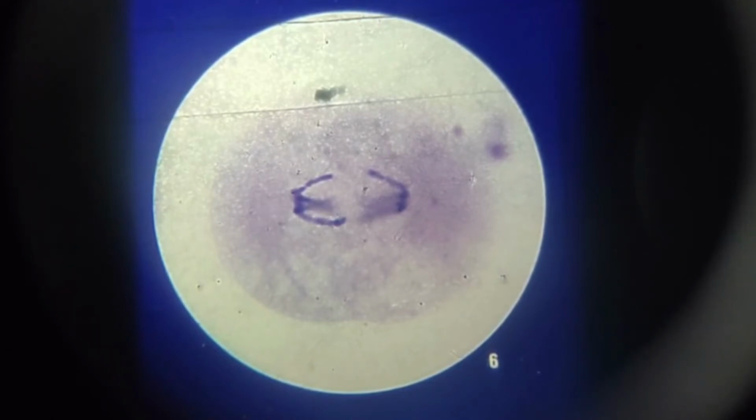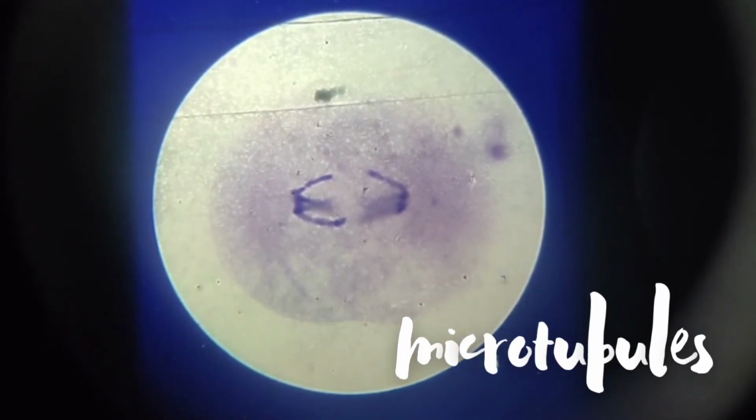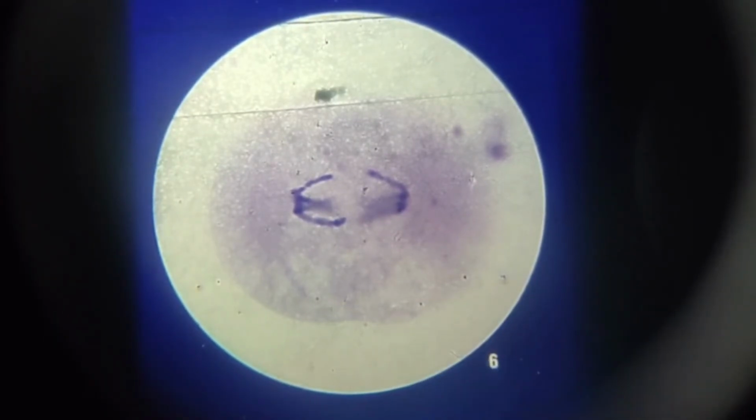Electron microscopes show that the spindle fibers are made up of extremely small structures called microtubules. Look closely at the chromosomes. Some of them appear to be beaded in places. Authorities on this subject believe that the long, thin chromosomes become short and thick by twisting into a tight coil. Sometimes the coil loosens up a bit, making the chromosome look beaded.